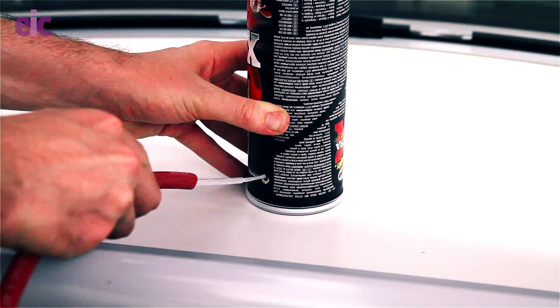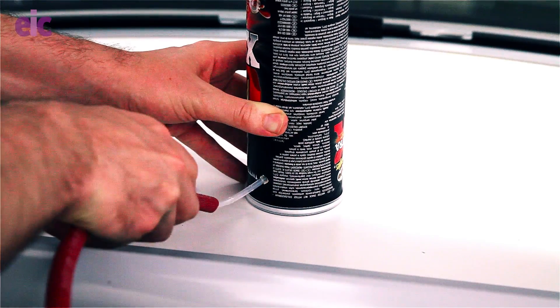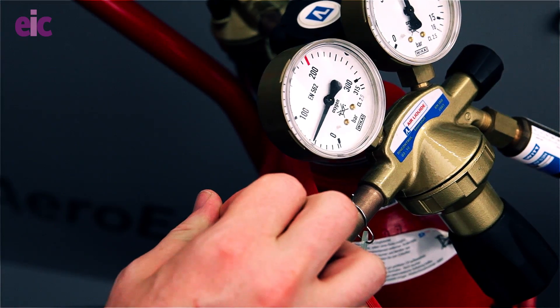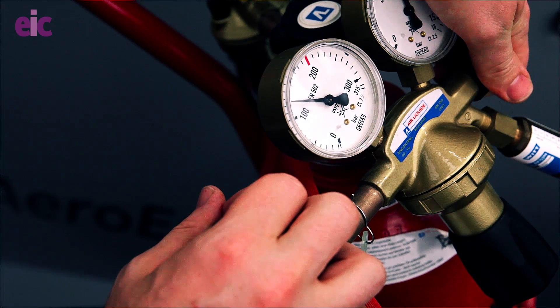Use a fume cupboard and flush the can for at least a minute to remove all the air. You may want to apply a little bit of tape over the top of the hole so you don't have to use your finger to prevent the gas escaping. Make sure you're working away from your fuel. Use a pair of safety screens to protect both you and the audience, and then you can light the top with a long splint on a ruler and then wait. You'll get a nice yellow flame which shrinks and gets bluer as more air is drawn in via the lower hole.